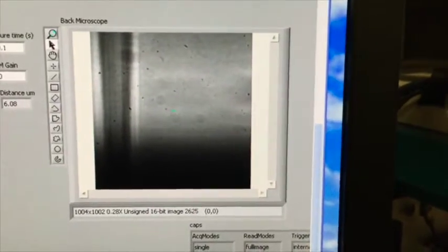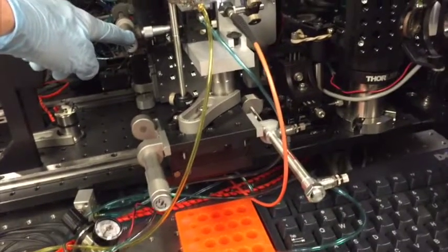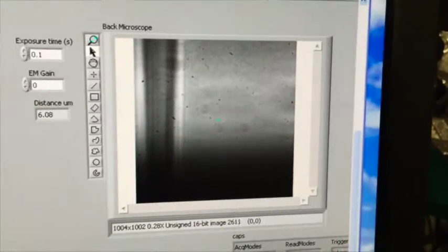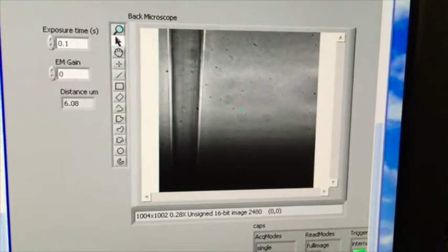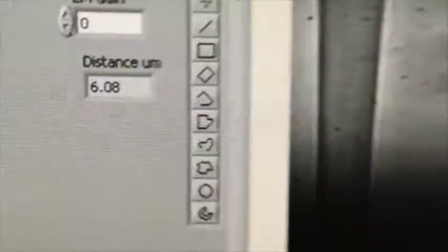So I'm going to focus that, and again, the focus knob is the one that's farther back right here, that's parallel to the camera, which is right here. So camera, focus knob for the camera. Alright, it's fairly good focus. This little mark right here is 6 microns. It says right there, 6 microns.